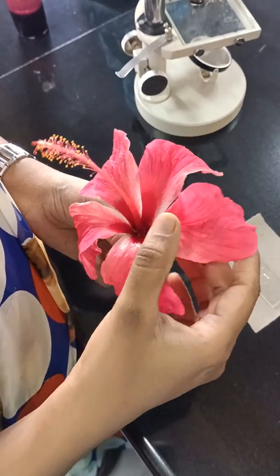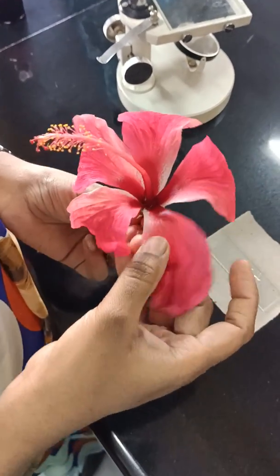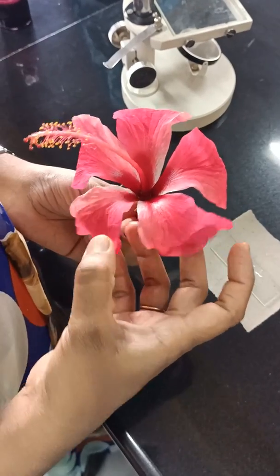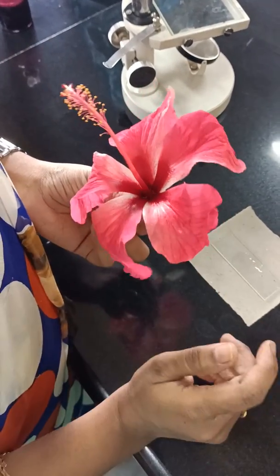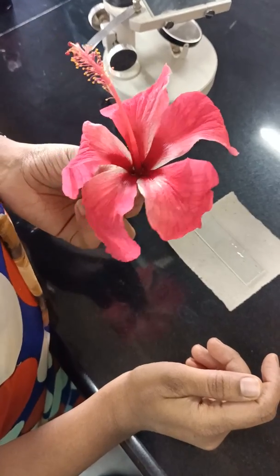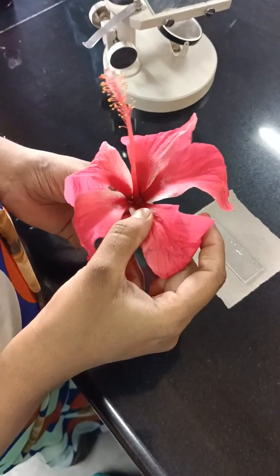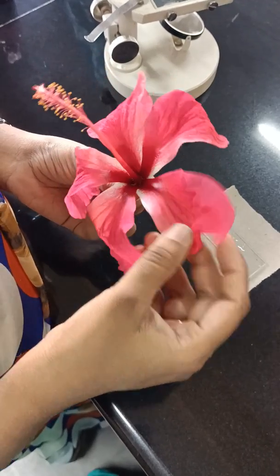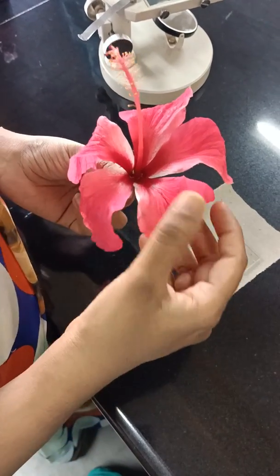Hello dear students, today we are demonstrating the first question that is temporary slide preparation. There are three choices in that first question. Now I am going to show you the TS of ovary. For TS of ovary we are going to use hibiscus flower.